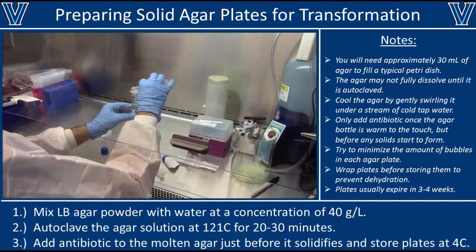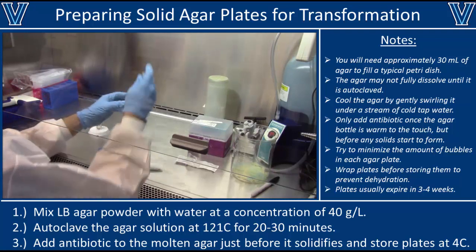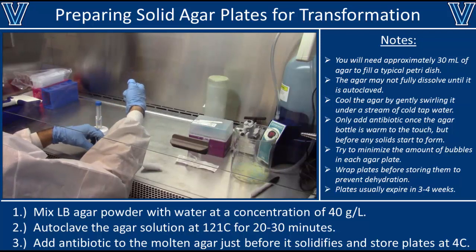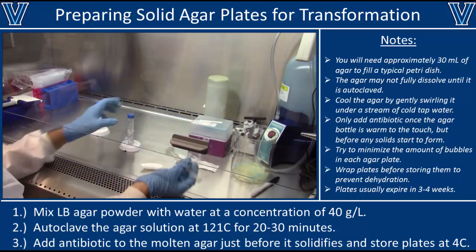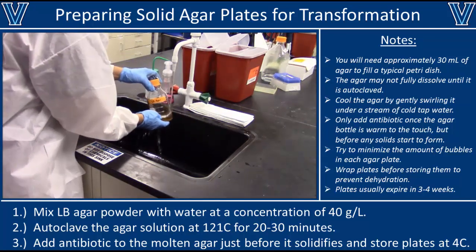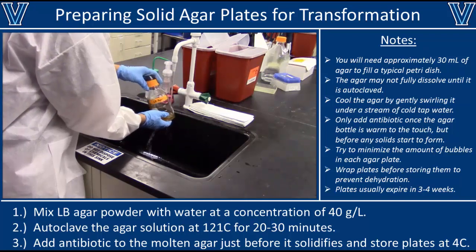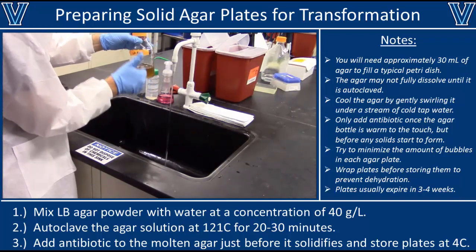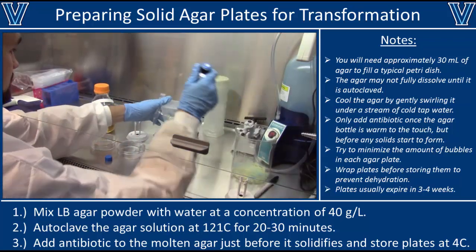In the biological safety cabinet, pour the antibiotic solution into a sterile syringe with a 0.2 micron filter attached to the end. Insert the plunger and force the solution through the filter into a sterile 15 ml tube. Now you have a sterile antibiotic solution. Note that some antibiotics are unstable at room temperature, so they should be stored in the fridge. At this point your LB agar should be lukewarm to the touch — if it's still too hot, cool it by running cold tap water over the bottle while constantly mixing, and watch for any signs of solidification.